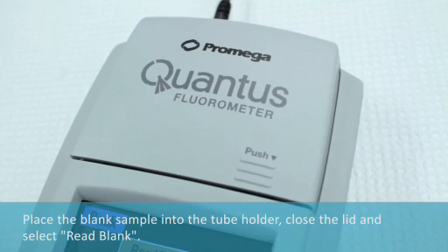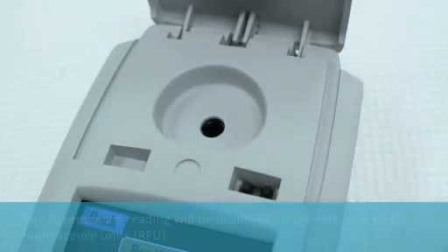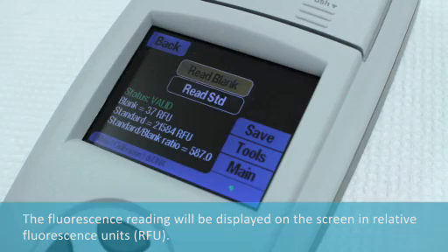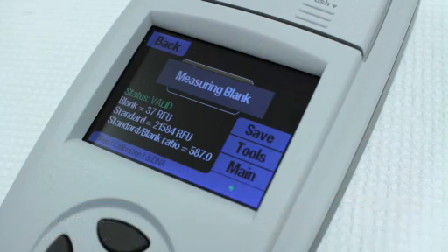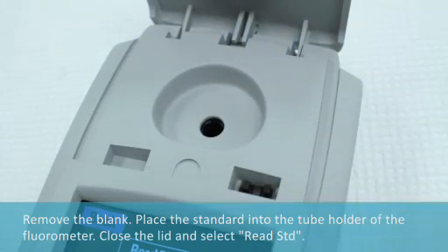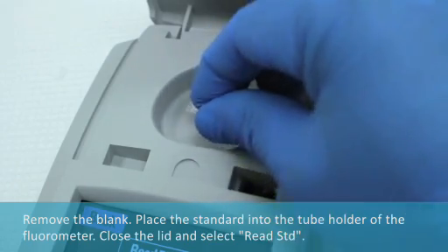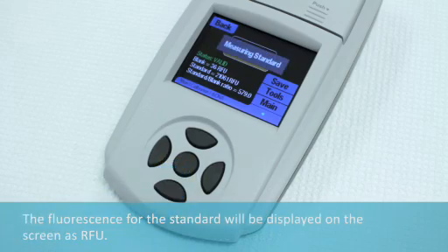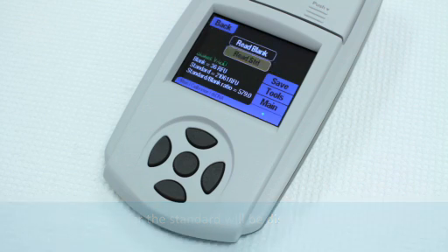Place the blank sample into the tube holder, close the lid, and select Read Blank. The fluorescence reading will be displayed on the screen in Relative Fluorescence Units, or RFU. Remove the blank. Place the standard into the tube holder of the fluorometer, close the lid, and select Read Standard. The fluorescence value for the standard will also be displayed on the screen as RFU.